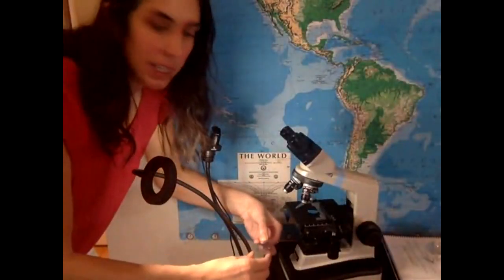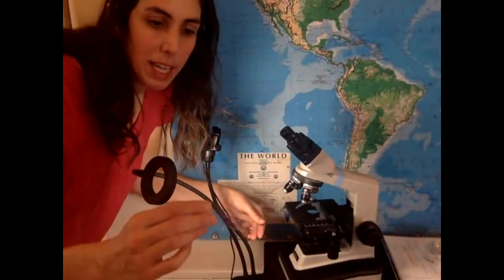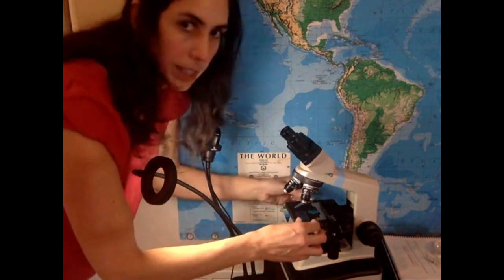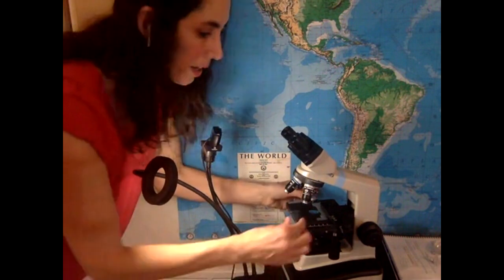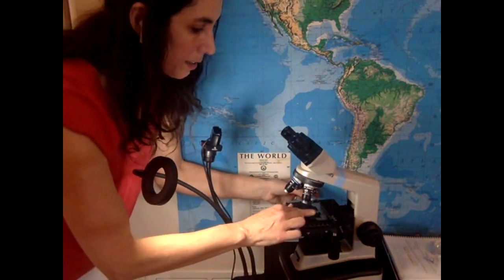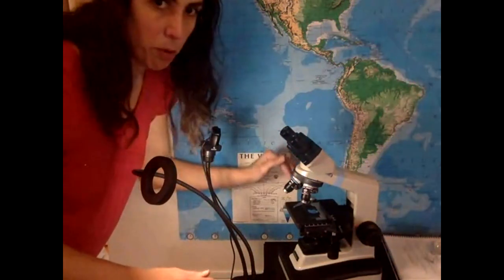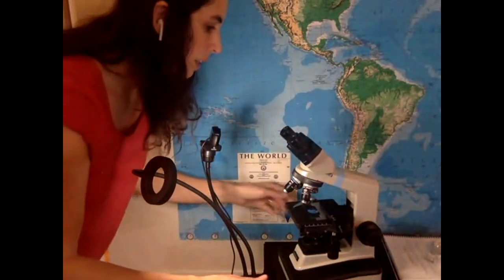All right, I made my onion sample, very thin slice. I put a dye that's methylene blue so that my sample has color. So a good slide for microscopy would be very thin and have some color, because what we see is the contrast. And then I push the clip away, stick the slide in there, and let go. You do not put the clip over the slide.